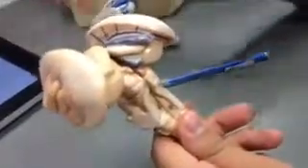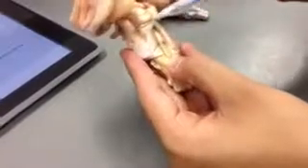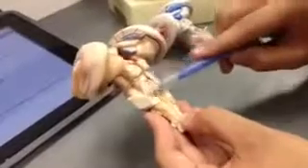Next, we have our superior cerebellar peduncle, which is right here, coming here, about halfway. That's going to be your superior cerebellar peduncle. The other inferior half is your inferior cerebellar peduncle, and on the sides here, these are your middle cerebellar peduncles. And then that would be what constitutes the hindbrain. This section right here is your pons, and your fourth ventricle is coming down here.